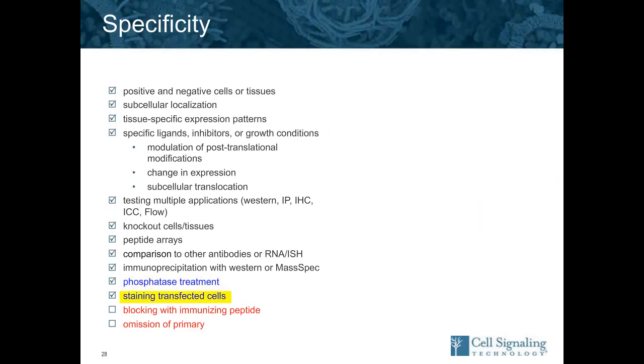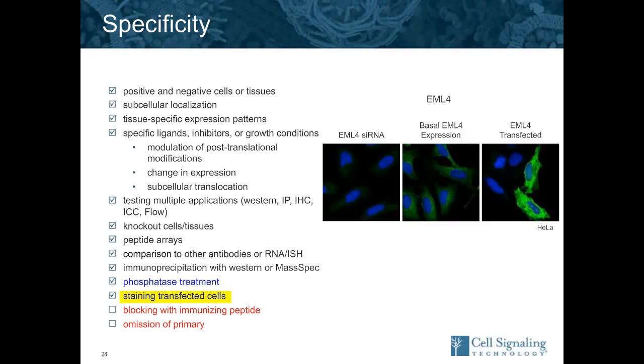The other one that I would caution you about is staining transfected cells. The example shown here is EML4. So I would direct you toward the middle image where you see dim but definitely positive basal EML4 expression in these HeLa cells. You can knock that down on the left with siRNA. But note what happens on the right if we transfect in EML4. Now only the transfected cells look positive, and you don't see the dim stain. So if this were truly non-specific stain, but you simply express the protein in cells, you would really see the transfected protein because it's often at a high expression, and you would miss the non-specific stain that's there in the background. As a rule, we try not to use transfected cell models for antibody validation.